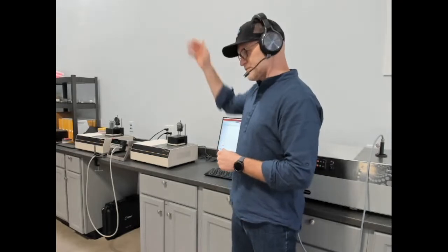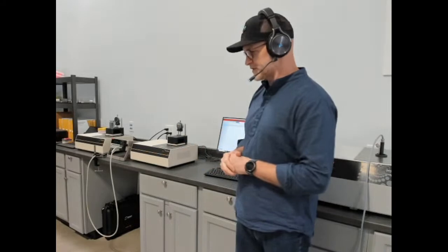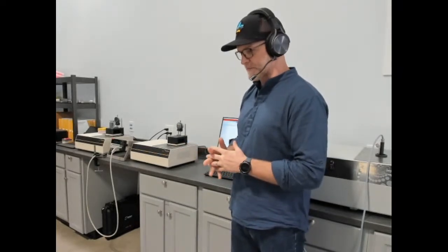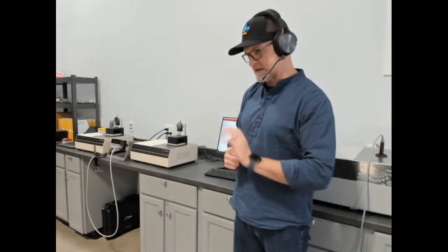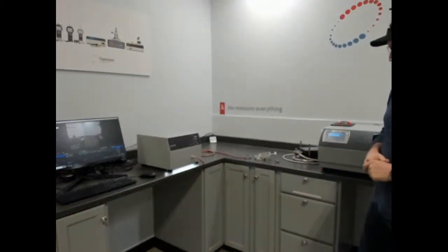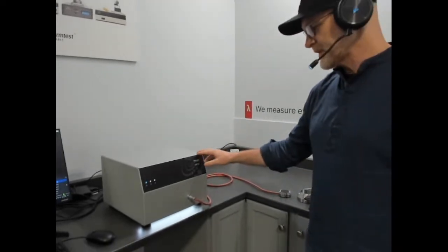And typically we have our MP2 at the end of the bench, but that's coming back from a show. Again, our MP2 is our portable version of the MP series. Really all the same methods that our MP1 has and our MPV, just with much more narrow ranges of use. So our MPV, maybe if we come a little straight on here, we can talk about the instrument.